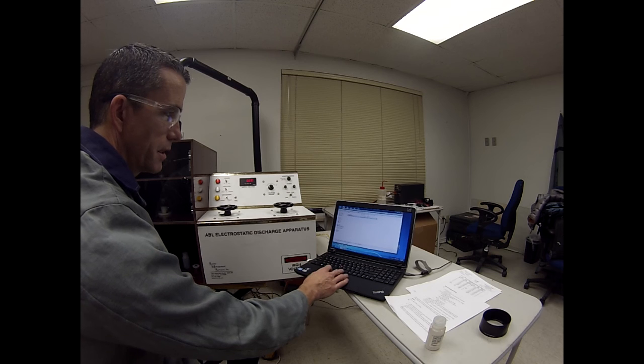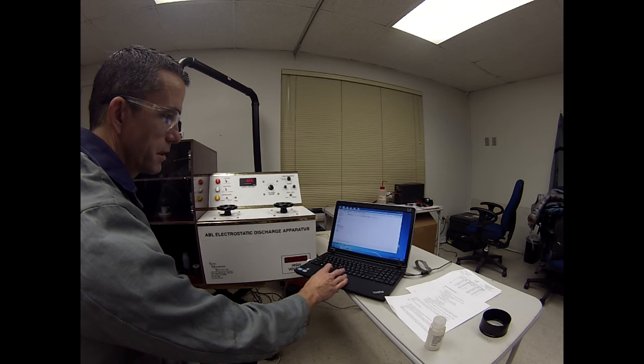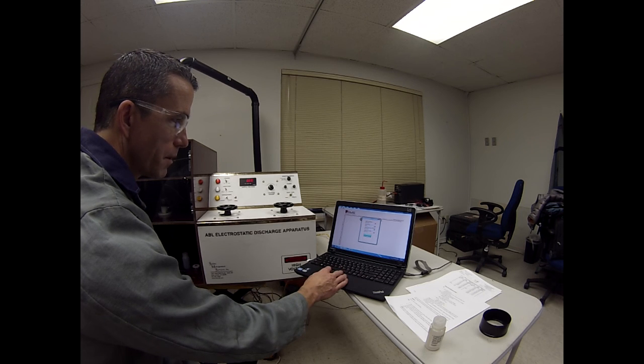You'll notice it's not listed here under 1500 because we didn't process the multiple files. So if I open that up again in GoDetect, hit ESD, pick where I was, that's the last place I was at.